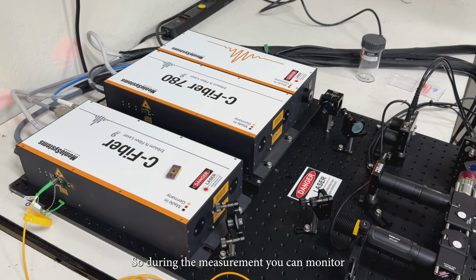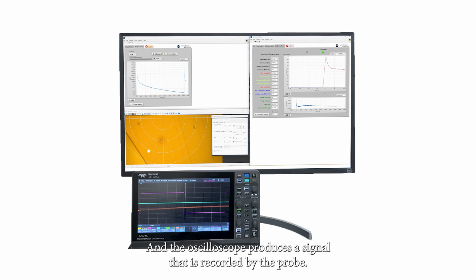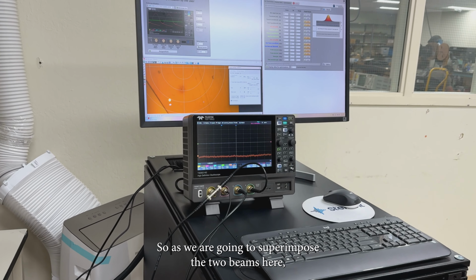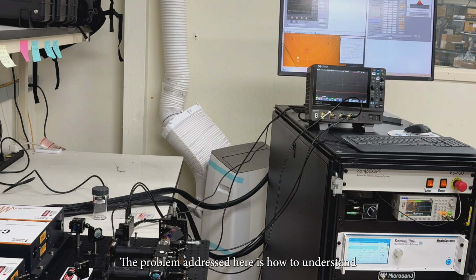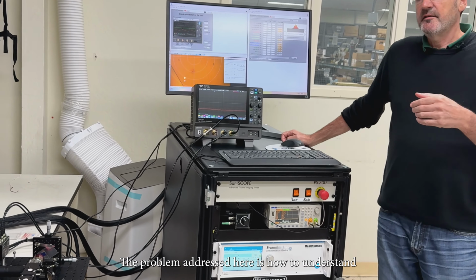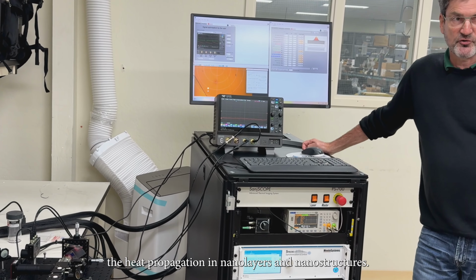So during the measurement, you can monitor the position of the two beams here on the screen, and the oscilloscope produces the signal that is recorded by the probe. So as we are going to superimpose the two beams here, you will see the signal growing here on the oscilloscope. The problem addressed here is how to understand the heat propagation in nanolayers and nanostructures.